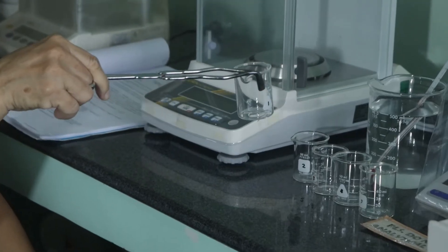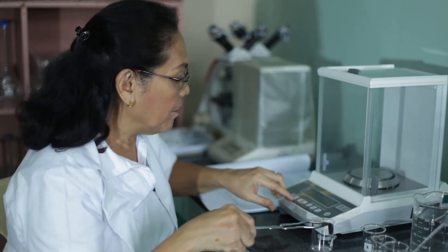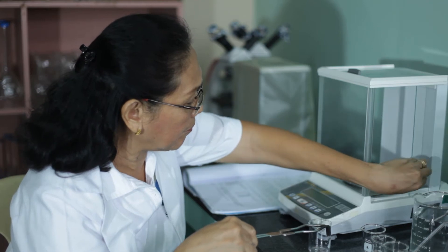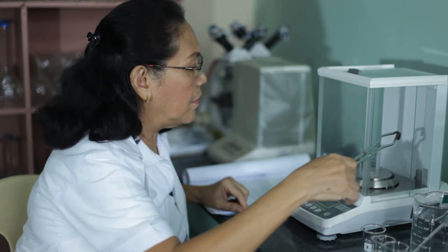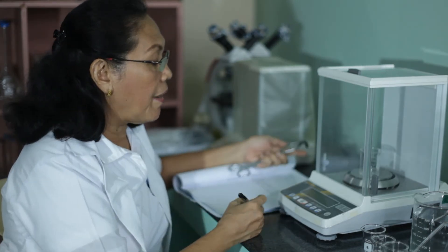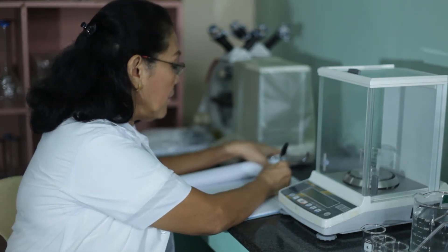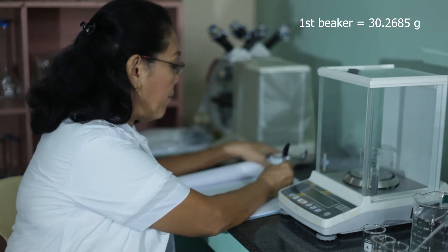Let's start weighing the water. Since we have five trials, we're going to use five beakers. This is beaker number one. In order to get the mass of the water, first we have to get the mass of the empty beaker. The mass of beaker number one is 30.2685 grams.